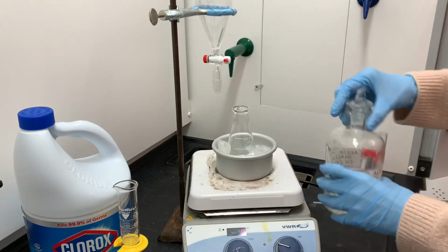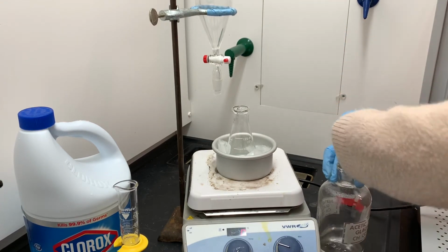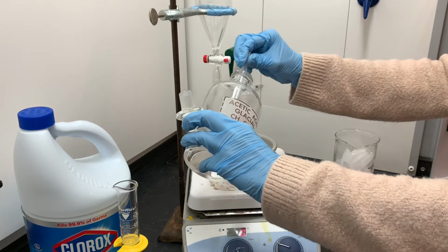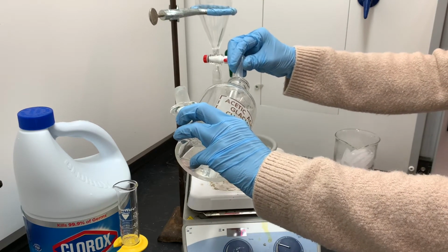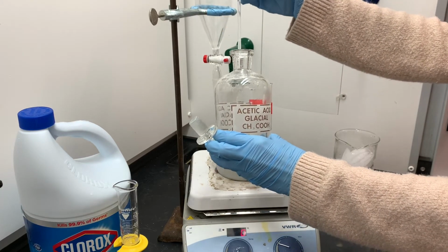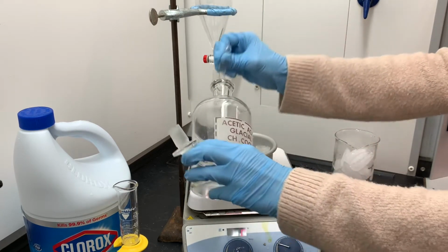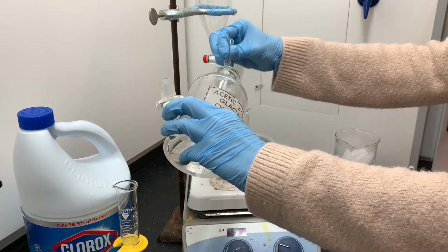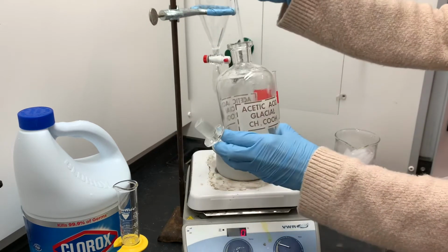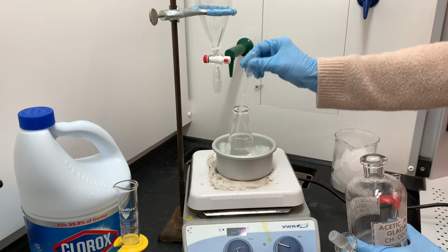So next up, I'm going to be adding the catalyst, glacial acetic acid. I'll be using this little plastic disposable pipette to add the glacial acetic acid. I only need 3 milliliters. Each one of these little plastic disposable pipettes is about 1 milliliter, so 3 squirts will be enough. It's important to note that these little disposable pipettes are not calibrated. They're not very accurate for measuring things out. But when we're just talking about a catalyst, it's not important that we get the volume very accurate, this works just fine.